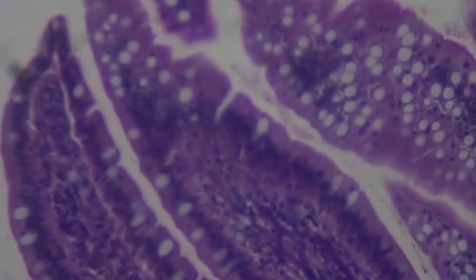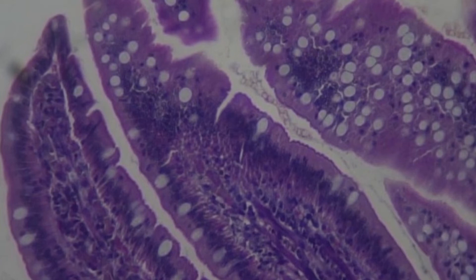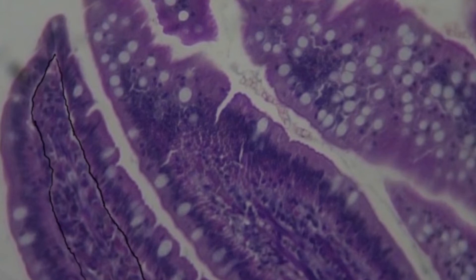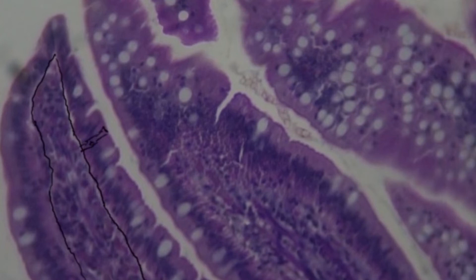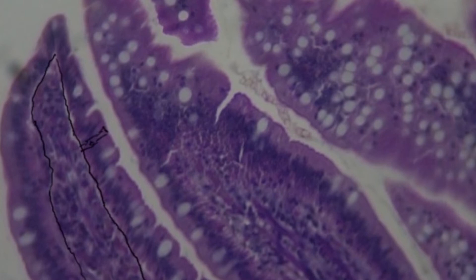Zooming in to the folds at the highest magnification, you can start to see the epithelial tissue. Since this is a cross-section of the organ, we're looking at the sides of the cells, which means we can see the basement membrane separating the connective tissue from the epithelial tissue. Everything between the basement membrane and the lumen is epithelial tissue. The jejunum is your example for simple columnar cells — if you draw out a cell, you can clearly see it's much taller than it is wide, and there is only one layer of cells touching the basement membrane. So this is simple columnar.